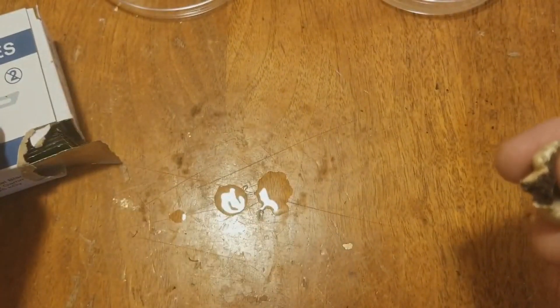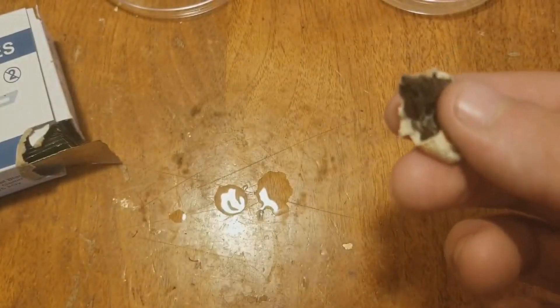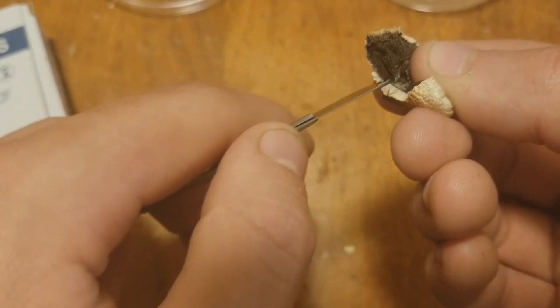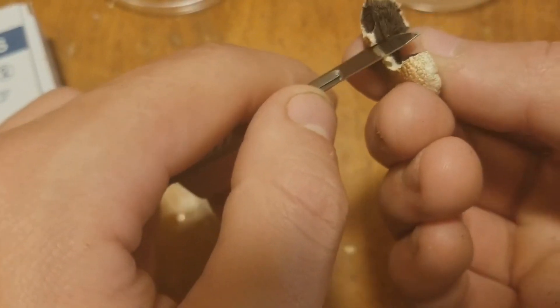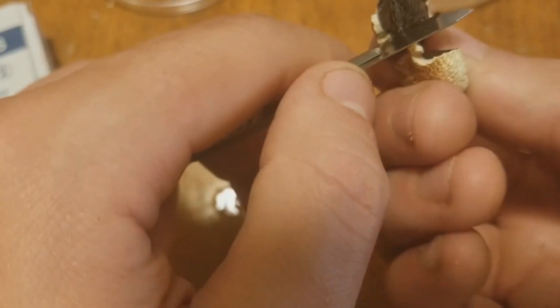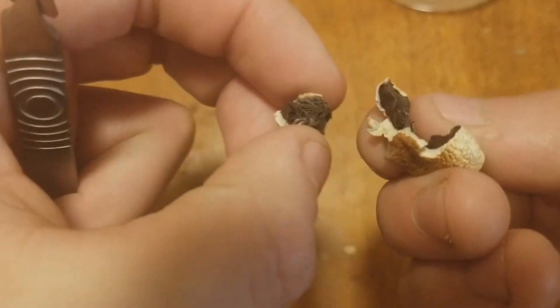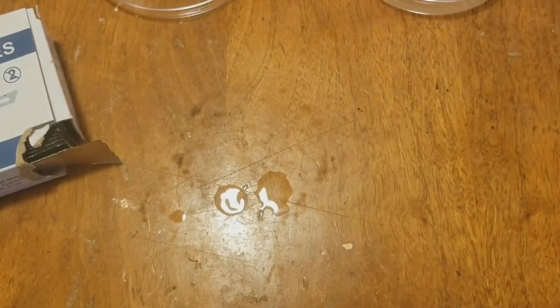I like to just stack them up, so I threw that on top of the box here and take another little rip to get a little piece. My brother just shared something on Facebook — shoutout to my brother, ladies and gentlemen! Now the rest of this mushroom you can save — it's still good, still edible.